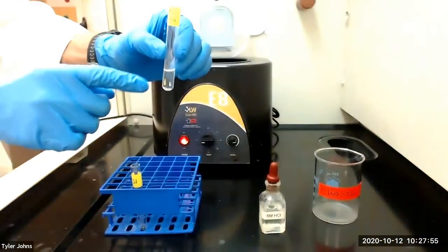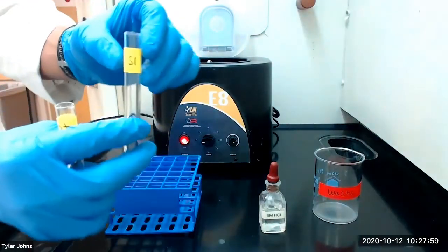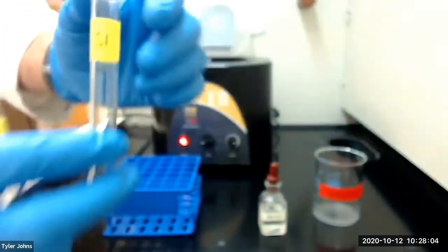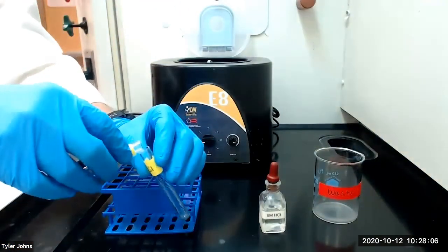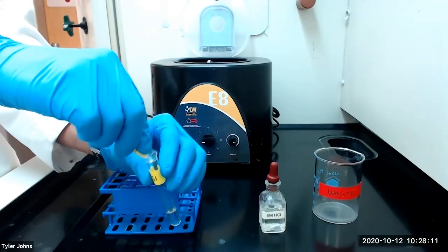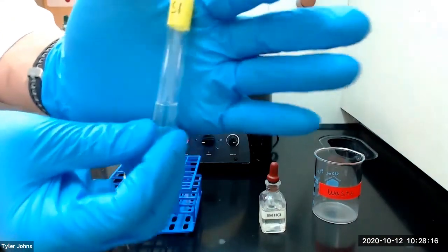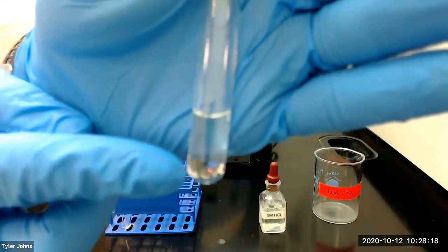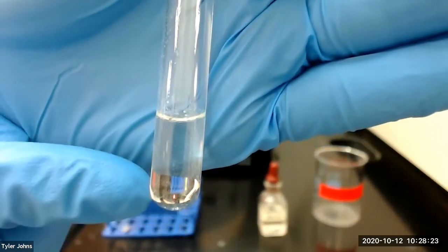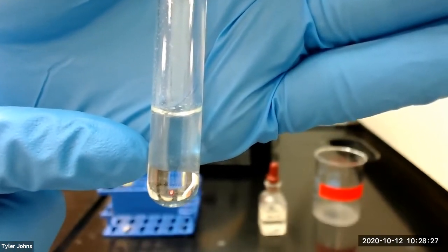We're going to decant the liquid from our solution into another test tube labeled S1, which stands for solution one. We'll then add a couple more drops of six molar hydrochloric acid to our S1 test tube to make sure that we precipitate all of the silver or lead from our test solution.